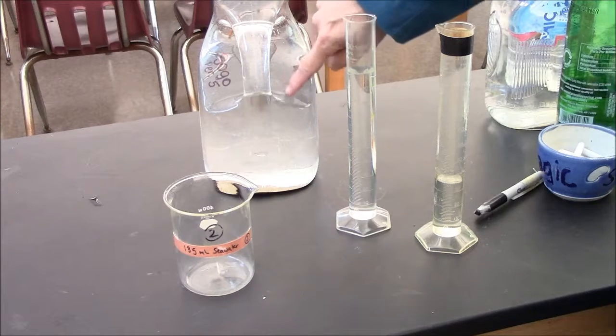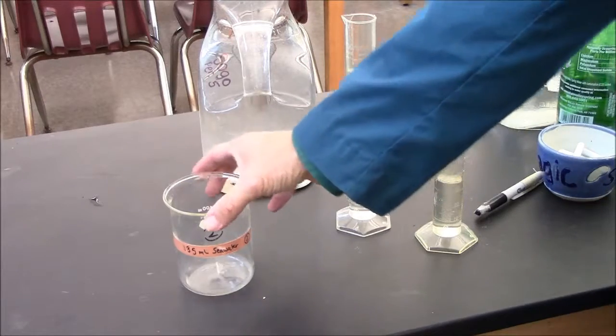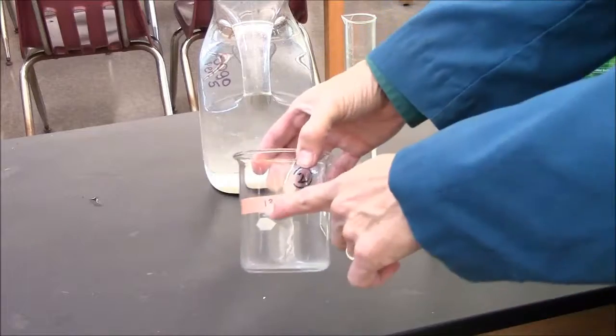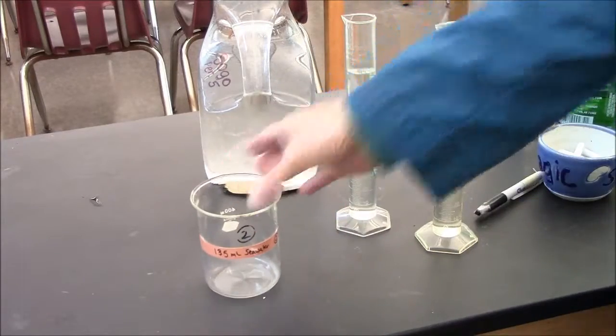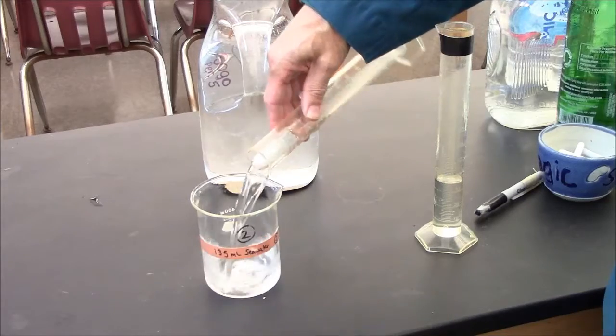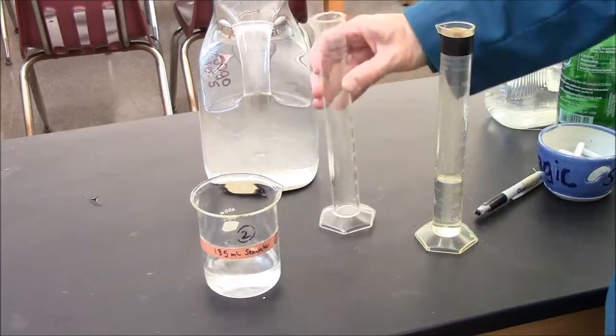Your classmates have collected water from the ocean. I will provide you with a measured quantity. This one says 135 milliliters of seawater, so I've measured that in a graduated cylinder. There's 100, there's the 35.